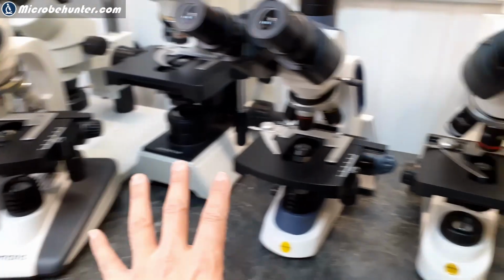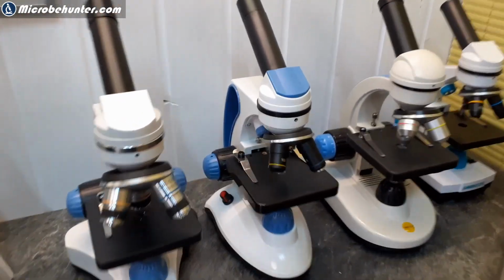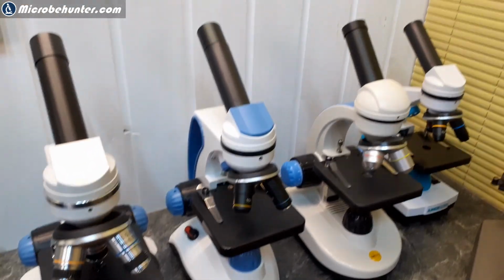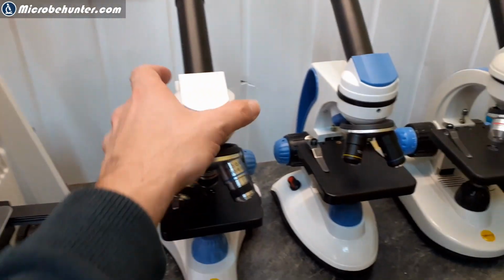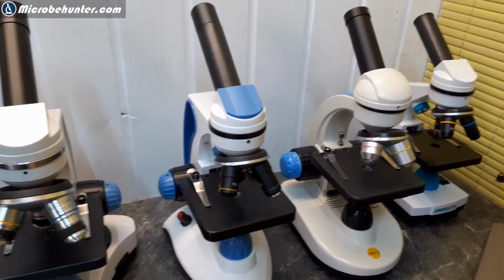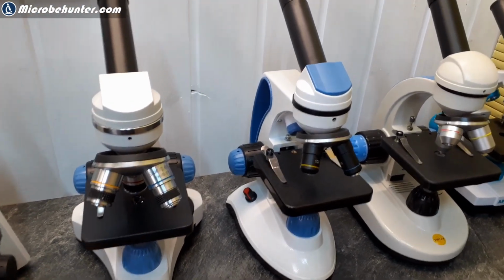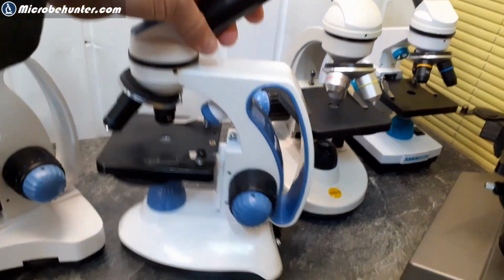Okay, so now let's look at the introductory microscopes, and I promised that I'm going to make a separate video for buying microscopes for children. And here we notice that, of course, they're much smaller, much more portable, and of course much cheaper. So those microscopes here cost around $60 to $80, 60 to 80 euros plus minus. They are, if you just put them next to each other, remarkably similar in some respects.